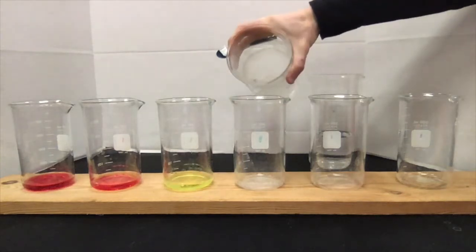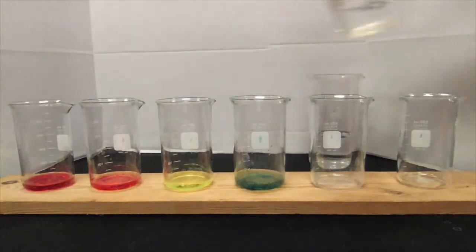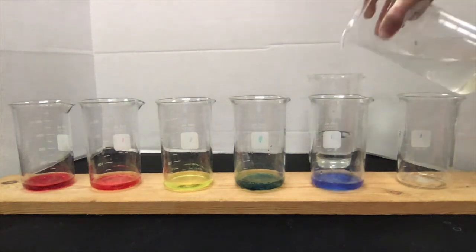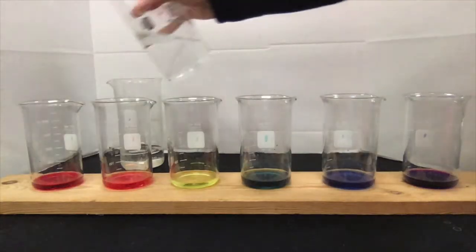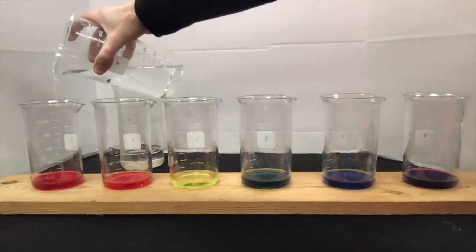You can see that a color change is happening. Surprised, huh? Well, watch what happens when a second clear liquid is added.